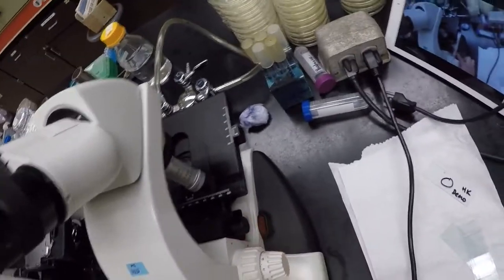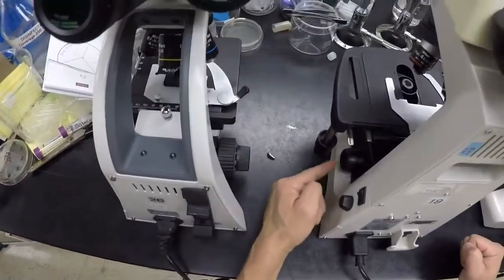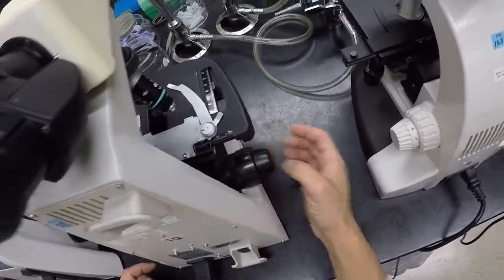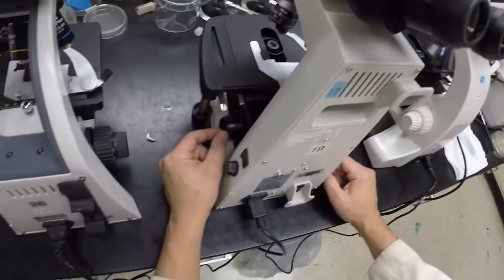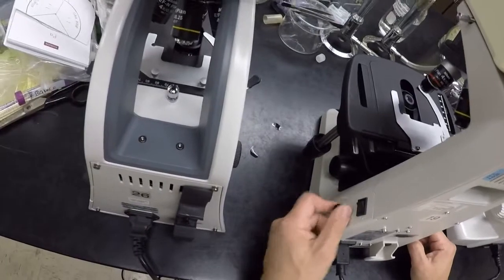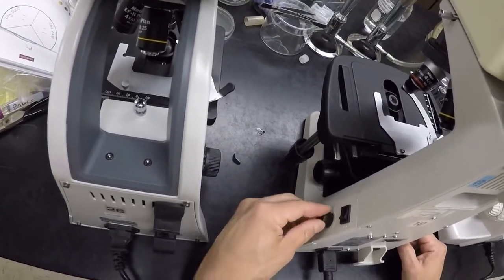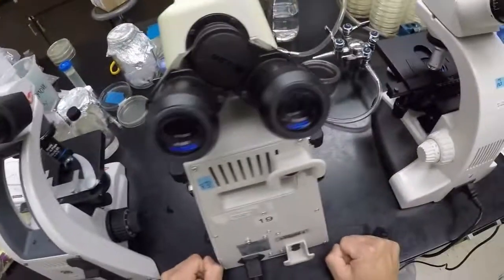We have some other microscopes, so let me just show you some of the differences. This one is our Nikon, right? So this one here has our coarse focus over here, and our fine focus on the right side, and on the left side we have only a fine focus. To turn the light on, and this one's not plugged in, so you're not going to see anything, but light switch on turns the light on, and then this increases brightness, right? So bright and dim. Otherwise the operation is the same.